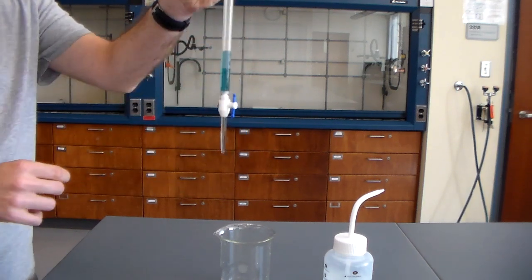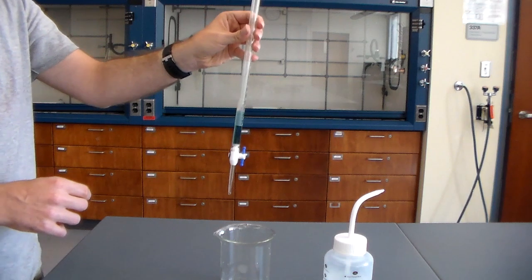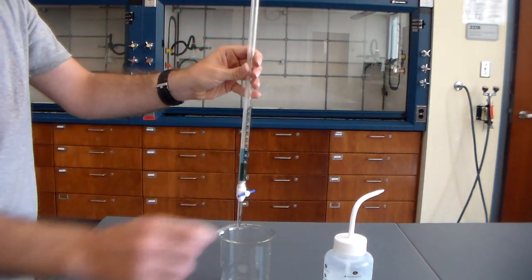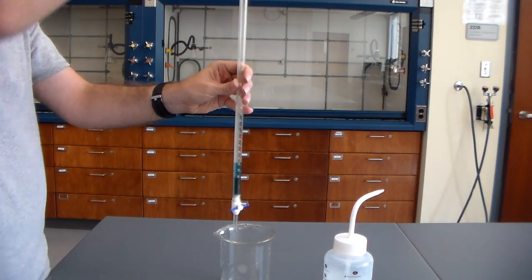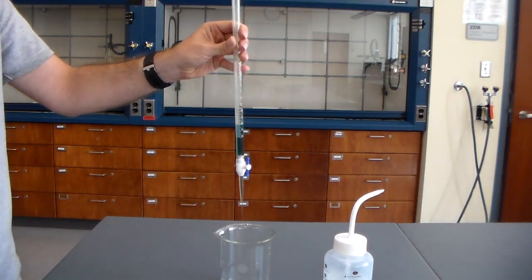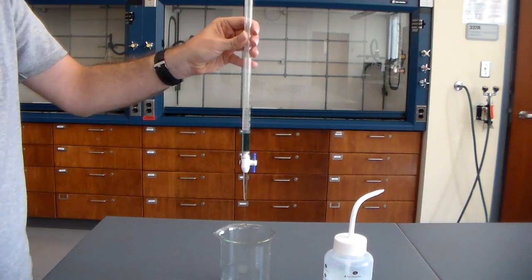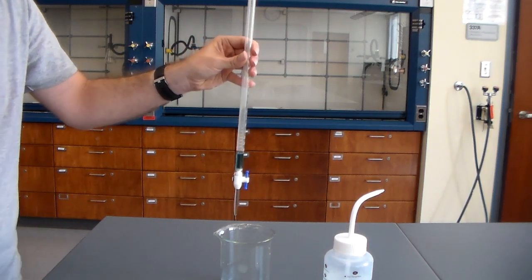Now actually we have a little issue right here. I have this open, and you'll notice that the water isn't coming out. This is actually due to surface tension. So there's just not enough pressure from the liquid up here to push the liquid out. If that happens, just close it up and then just add a little bit more liquid, and that will increase enough pressure that will push the liquid out. So hopefully it should work now. There we go. So most of the time that's not actually because it's clogged, it's just a surface tension issue. So we've rinsed this out now, and now we can be fairly confident that we're not going to have any dilution from any residual water left in there.